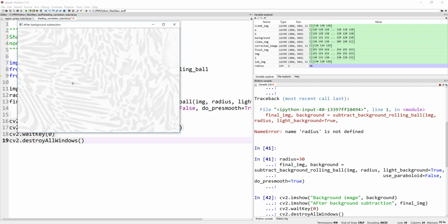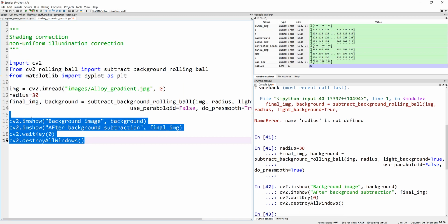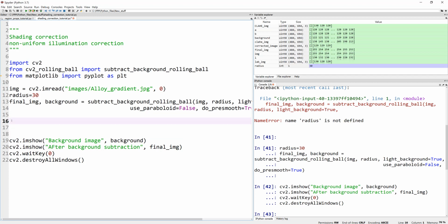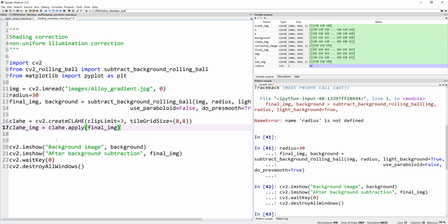Now, what do we do with this after background subtraction? That doesn't look that great, actually. So I normally recommend, after using this, performing contrast limited adaptive histogram equalization. The exercise that we have done before makes sense to do right here to make sure we have a decent image. So I'm running this again.